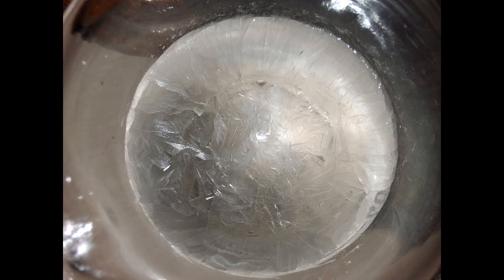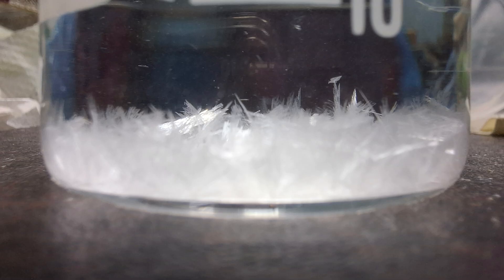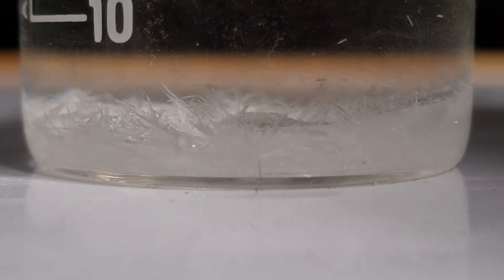Afterwards, with a smaller amount of benzoic acid, I performed the same recrystallization. But this time, I allowed it to cool for longer, which produces larger crystals as shown in this clip.